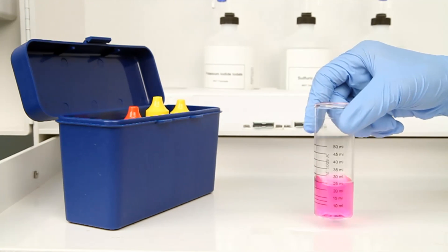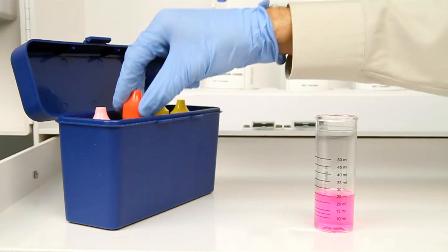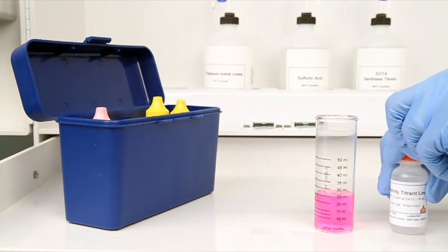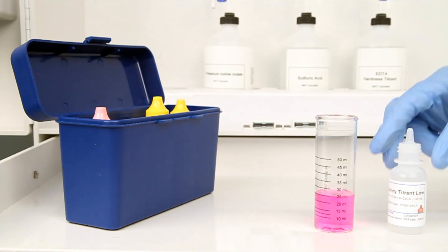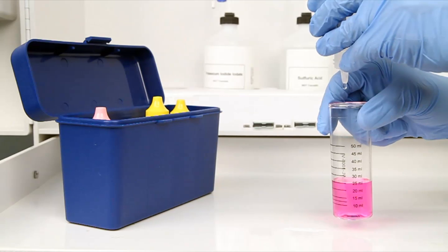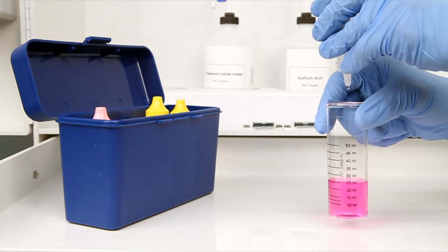In this example, the sample has turned pink, indicating that there is alkalinity that needs to be neutralized before the chloride test can continue. According to the Endpoint ID procedure, alkalinity titrant is used to do that neutralization. The bottle contains a dropper tip, so it is important to hold the bottle vertically to get a consistent drop size.